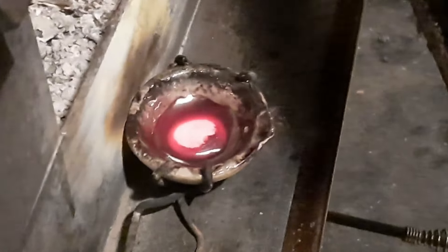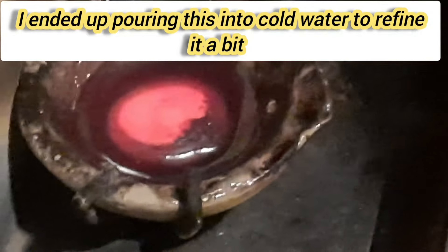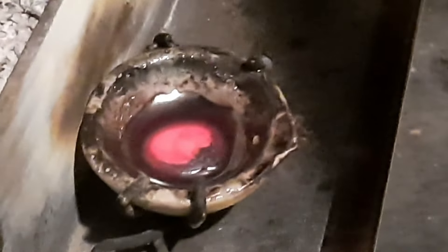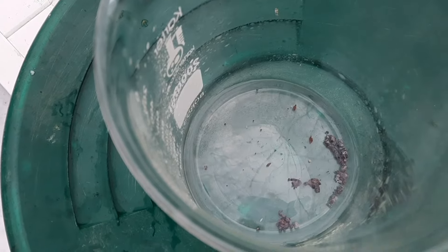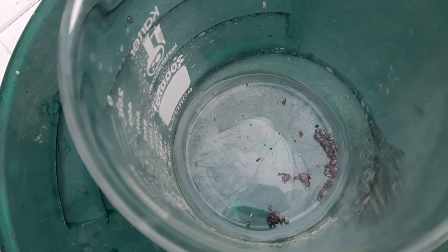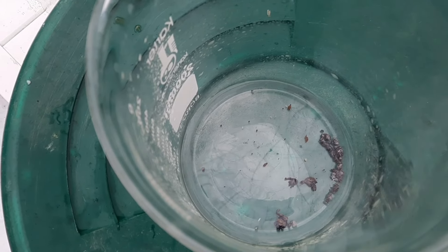There it is — she is cooling off right now. We're going to pull that bad boy out, weigh her up, and see what we got — not looking too shabby. I've melted it down and then poured it into water. I had a little bit of silver that I alloyed it with. Now I'm going to add a little bit of nitric acid to dissolve any base metals, then melt it down to get a nice pure button. Let's pour in some nitric.